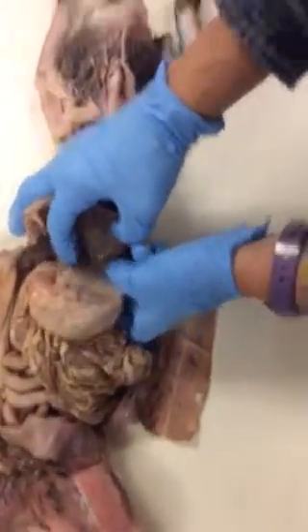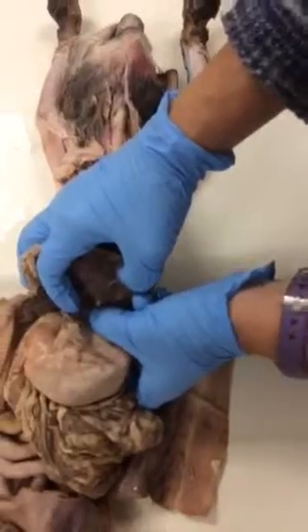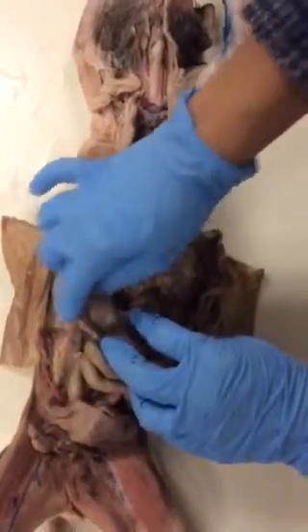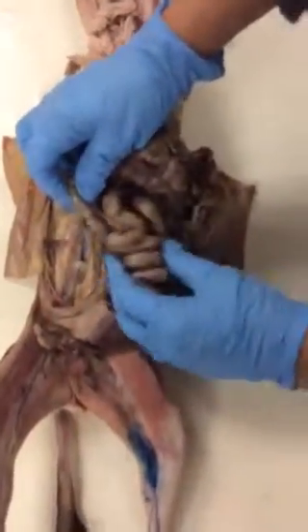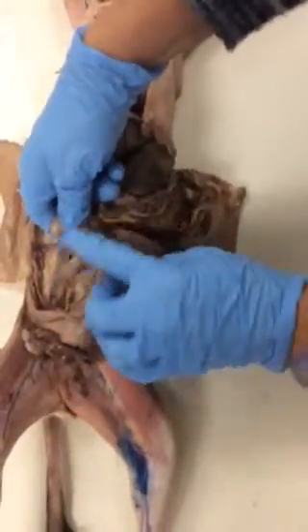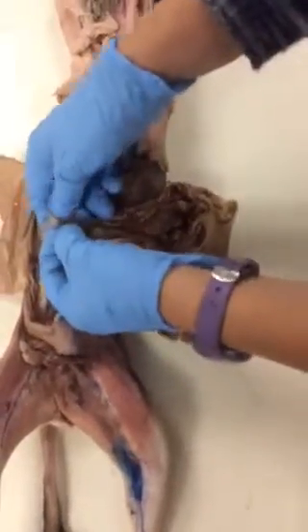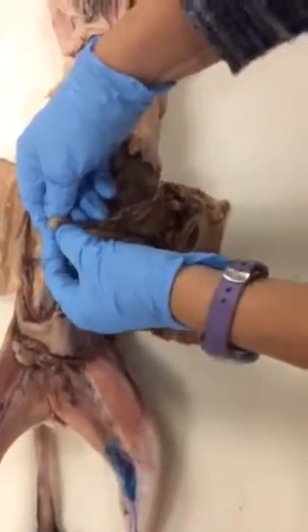It's hard to see here, so I will not do it. I will do it on the model too, where we have the esophagus coming in. So the duodenum ends roughly at this curve here, going into the jejunum. If we follow it all the way through, we come to the ileum going into the large intestine, starting with the cecum, which is just this bubble thing.